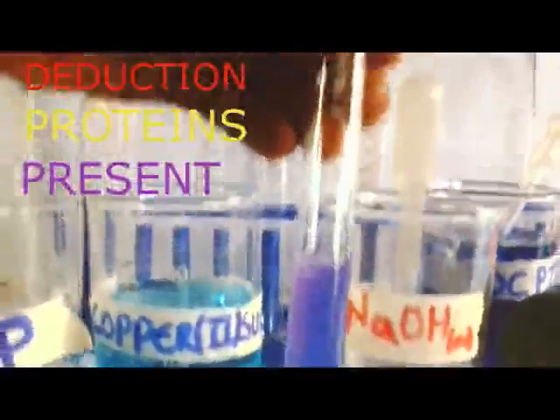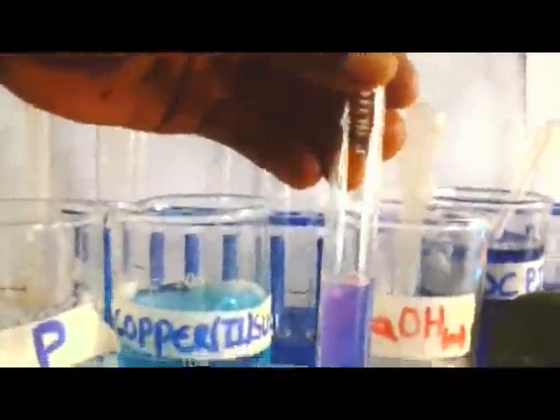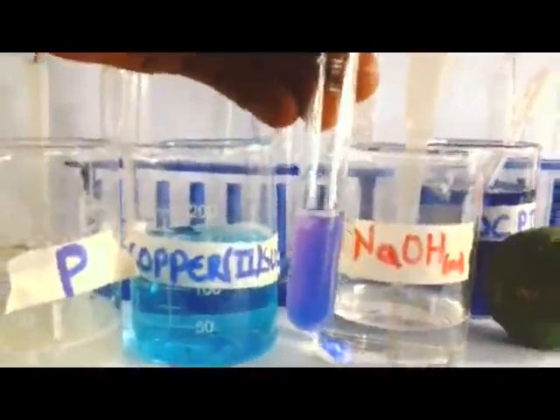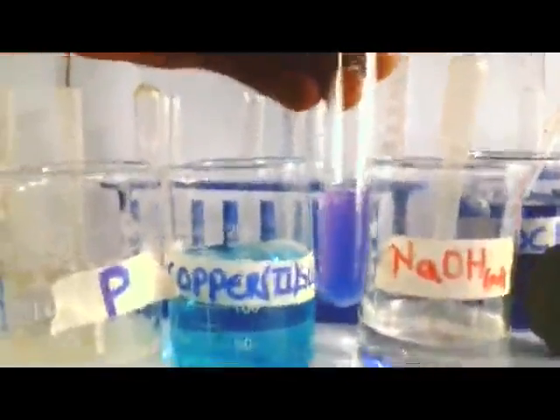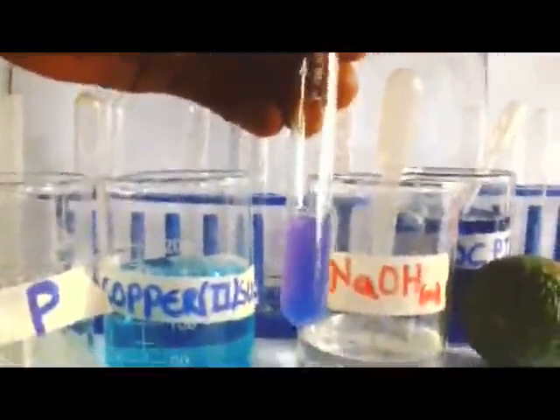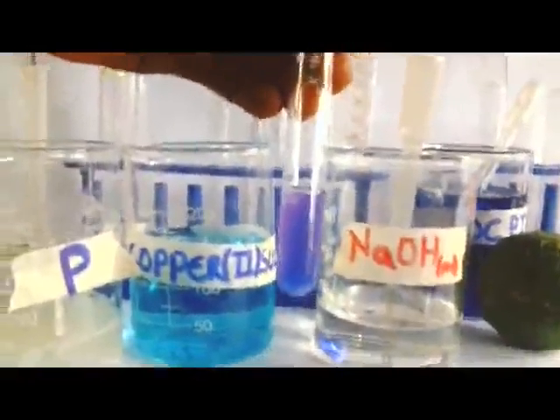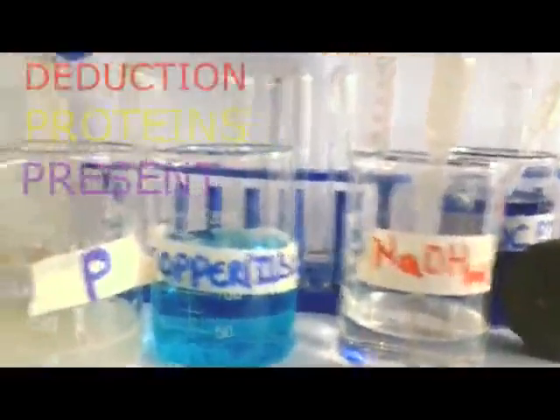Remember, proteins can also be tested by using Millon's test. But for me, I've carried out this one for Biuret. Now, don't forget that proteins can be in eggs. We have used an egg. The meat you enjoy, cowpea, milk, and so on. Everything which I've mentioned there contains proteins.